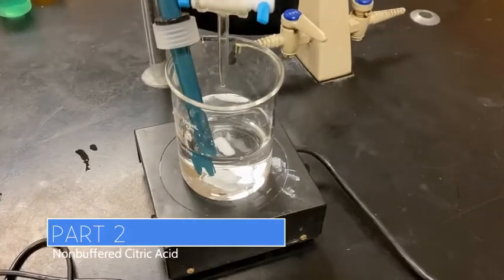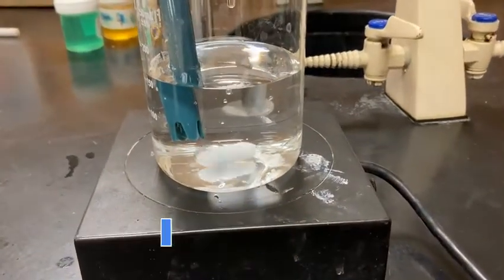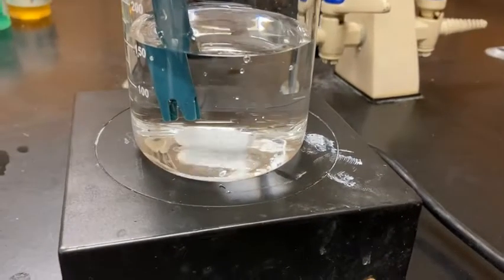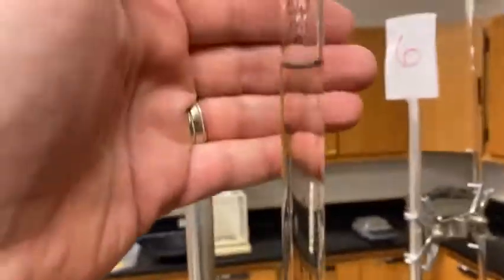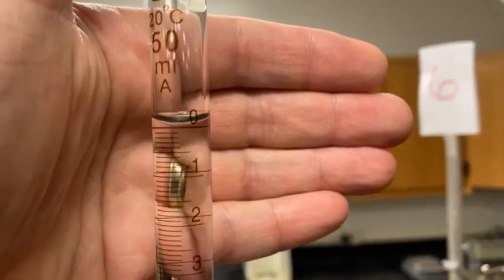All right, time for citric acid. So I poured the 40 milliliters of the citric acid into some distilled water, again, to make the volume large enough that the stir bar on the bottom wasn't hitting into our pH sensor. Refilled the burette with 0.1 molar NaOH just to get it back up to a level of 0.00 for initial.